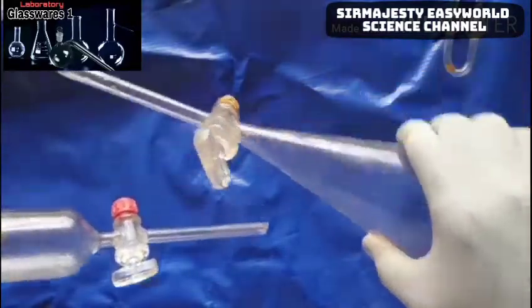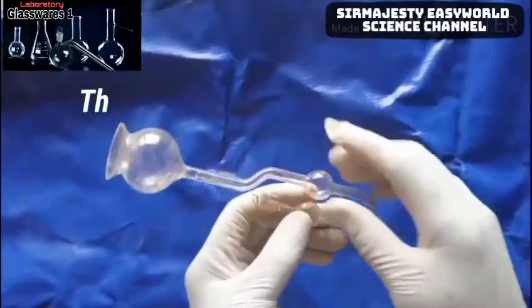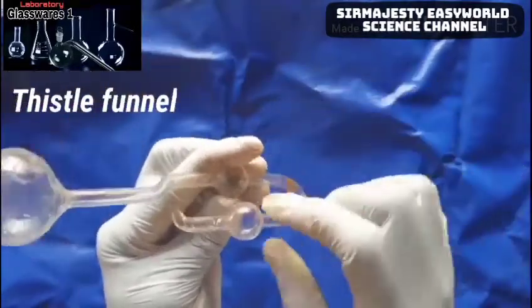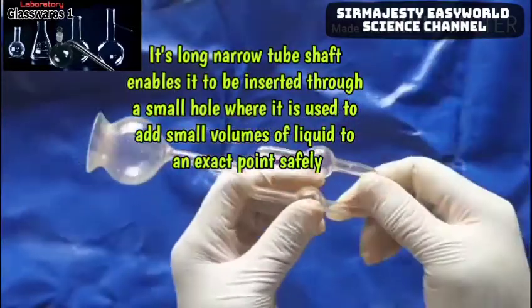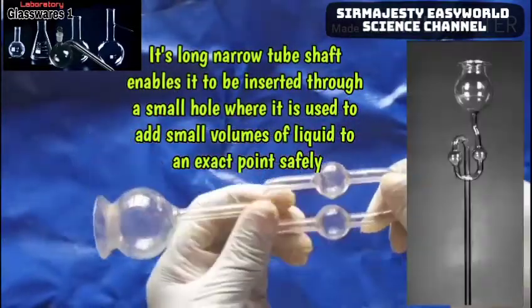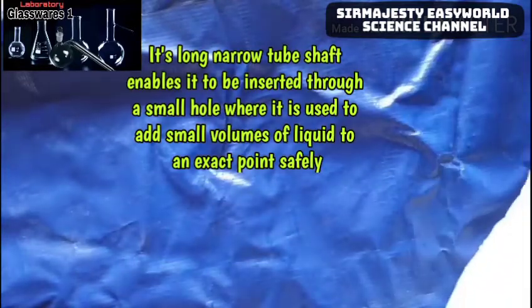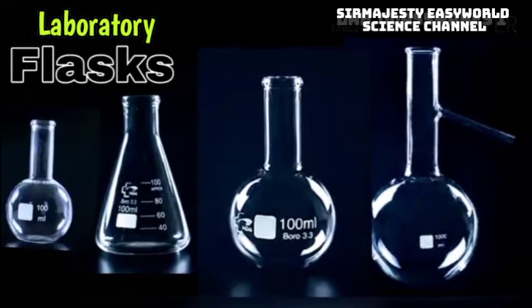This one has broken a bit — this is the thistle funnel. This arm has broken; it is a two-bulb thistle funnel, very long. You can see the usage on the screen. That's it for the funnels. Next, we'll take a look at flasks.